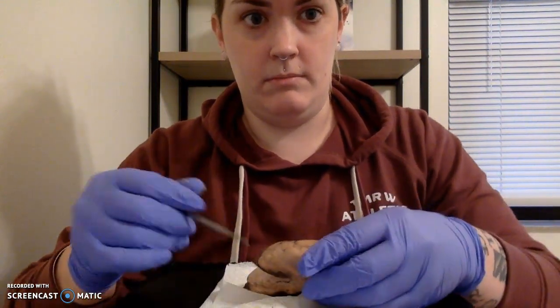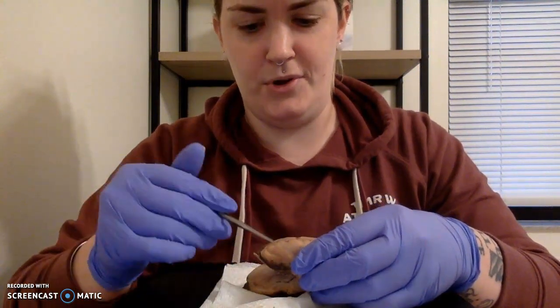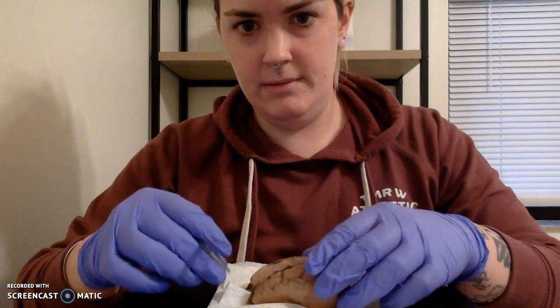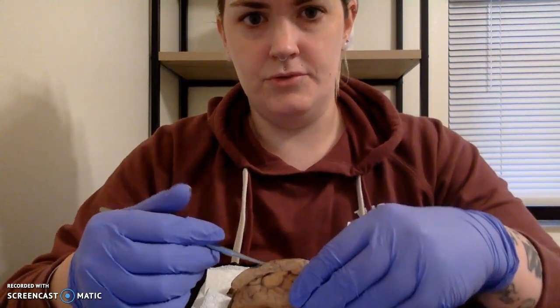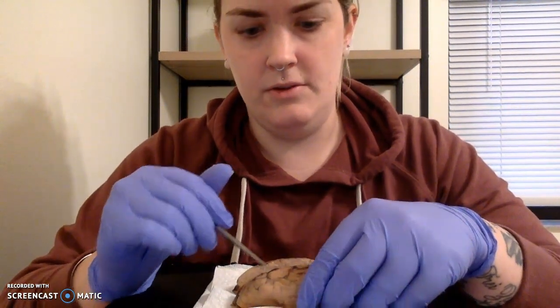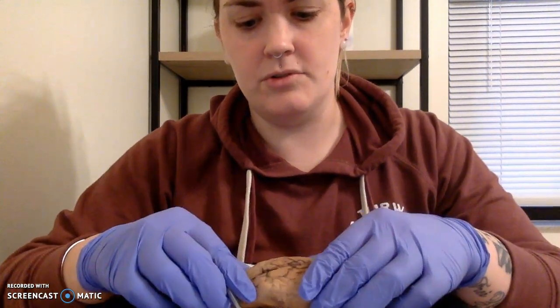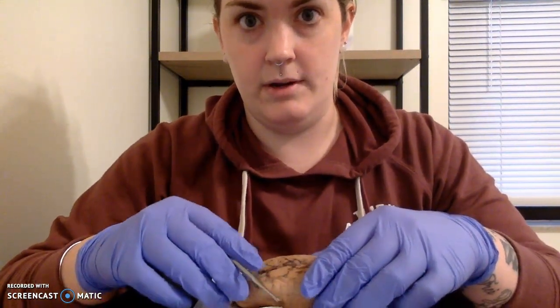I'm just going to pick it up. It's going to be right about here. Yep, you can see my hand shaking a little bit. I'm so sorry. Okay, our occipital lobe is located in the back here, with our cerebellum that would sit at the very, very end. Then you will see our gyrus, which is these ridges that are on the surface of the brain. And then you'll also see those indents, the sulci, which are the grooves of the brain. Both of these structures are very visible on the very top portion of our exposed brain.